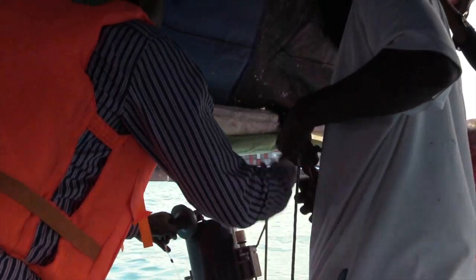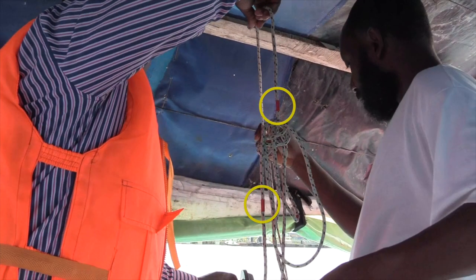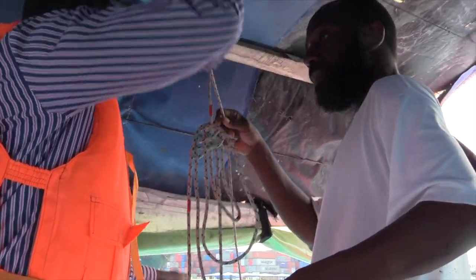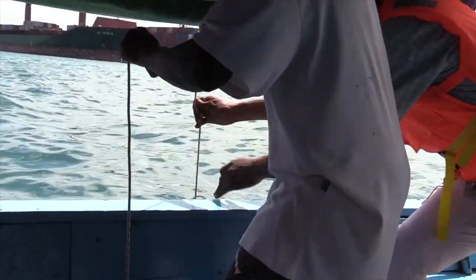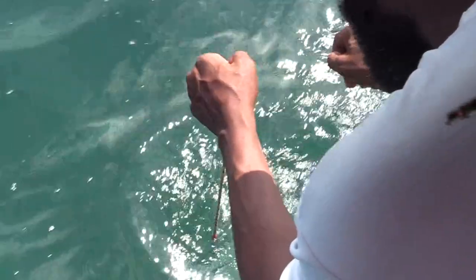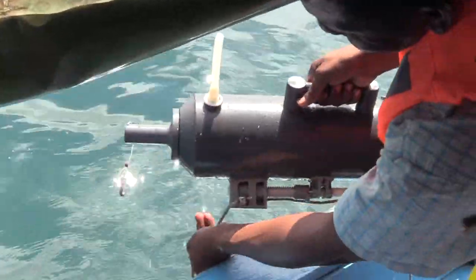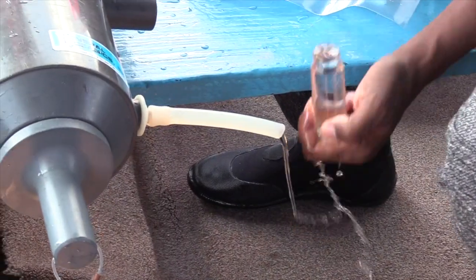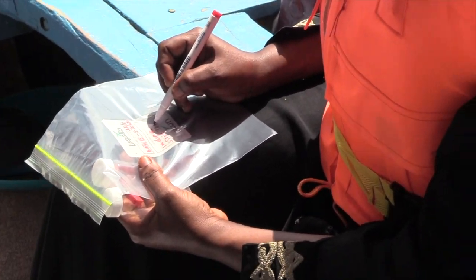To collect seawater samples at different depths, we need a water sampler. On the rope you can see different depth markers in red. We send the open sampler down into the water column, then the messenger is released, which closes the sampler, retaining the water at the desired depth. The water sampler is retrieved full of water. Before placing the samples in the bag, we note where, when, and at what depth the sample has been collected.